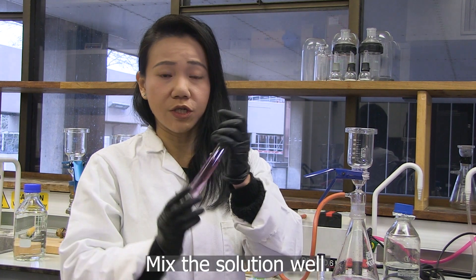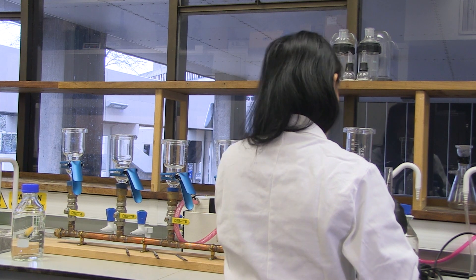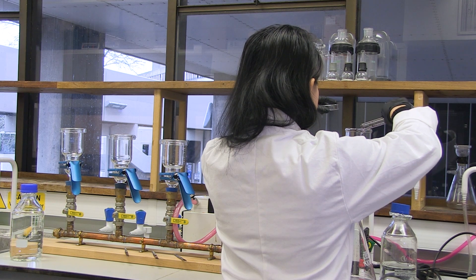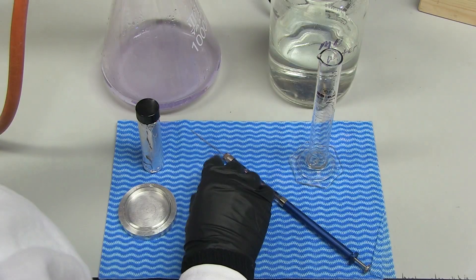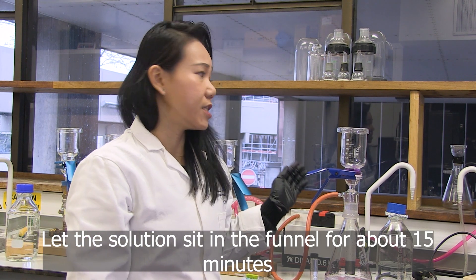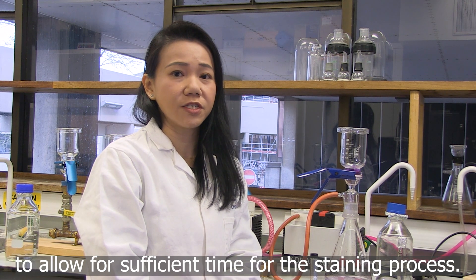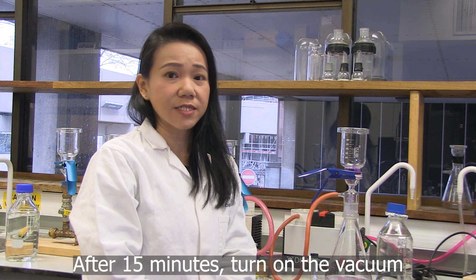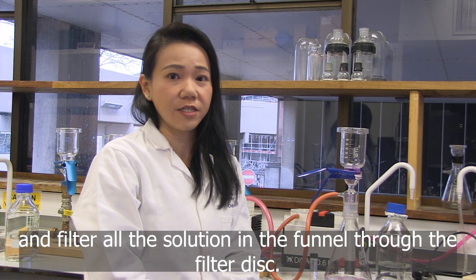Mix the solutions well. Pour the solution into the filtration funnel. Let the solution sit in the funnel for about 15 minutes to allow sufficient time for the staining process. After 15 minutes, turn on the vacuum and filter all the solution in the funnel through the filter disc.